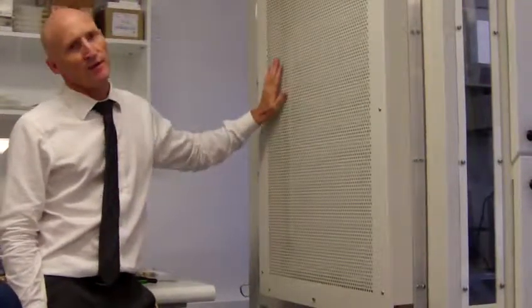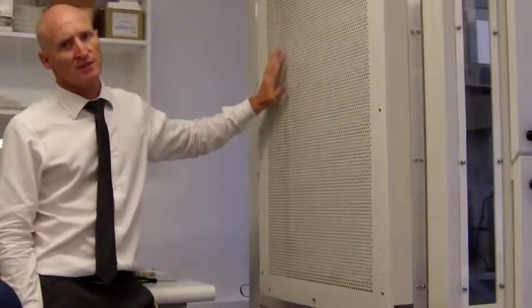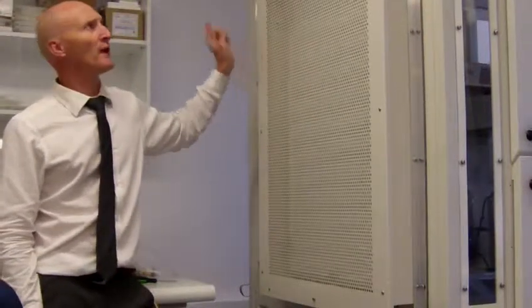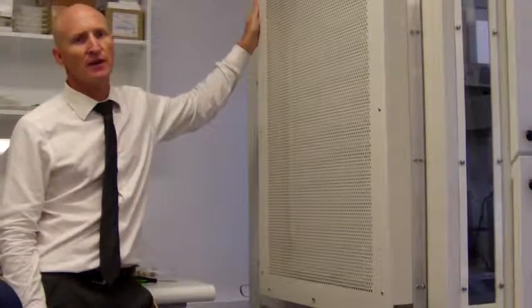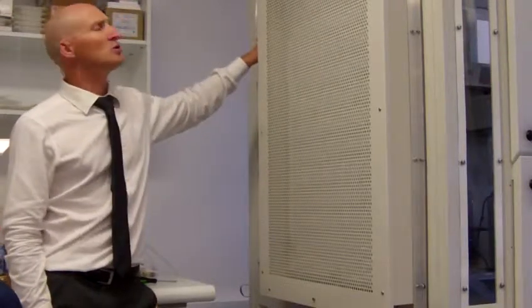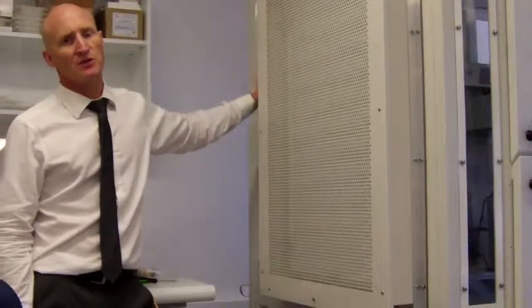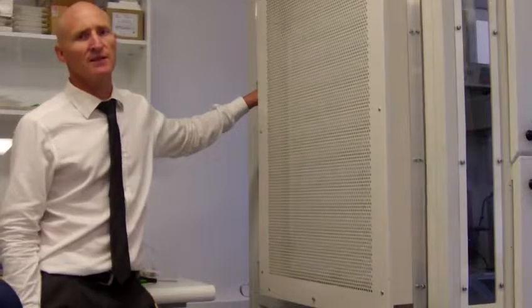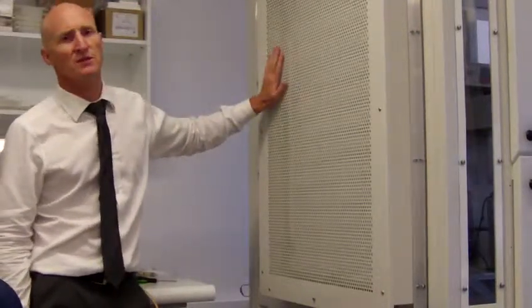It's very important that you make sure that the flow rate for this HEPA filter is at least twice the inflow rate for the Bigneat. And they do vary, so you need to check your particular documentation for your particular Bigneat to ensure that there's enough air going to escape from here so that the unit doesn't get pressurized, because effectively we're going to seal this completely, so all the air coming out of this hood comes through this HEPA filter.